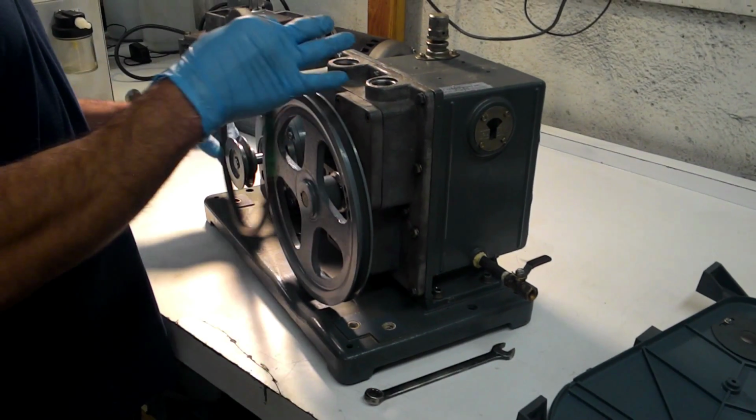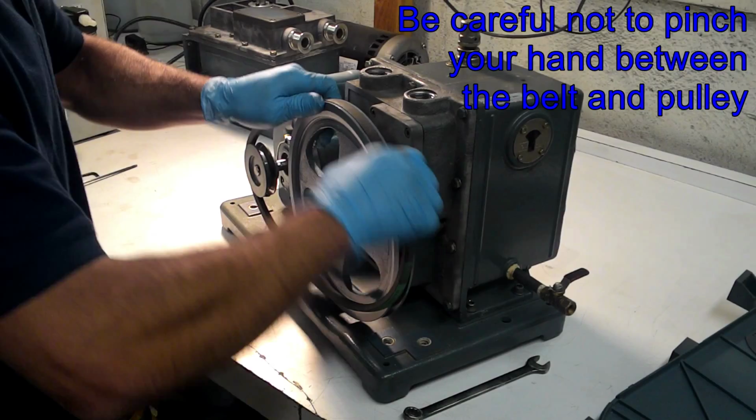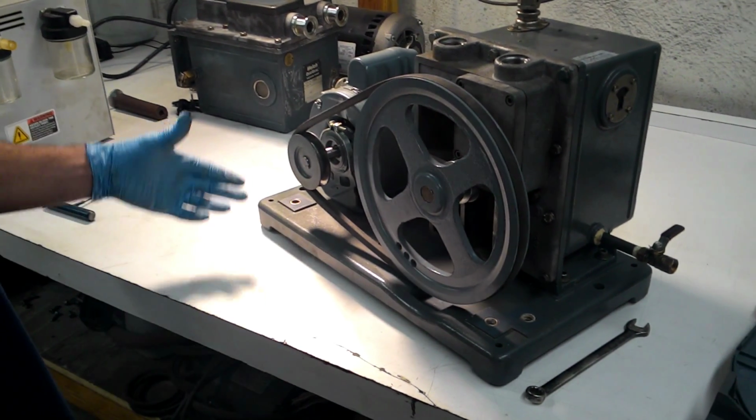So when you go change your belt, like I said, you take the old one off and you're going to take the belt, you're going to put it on the motor part first. You bring it over the top here, and all you do is you turn the pulley and the belt pops in place. So now you have this play. How much play should you have in this motor?